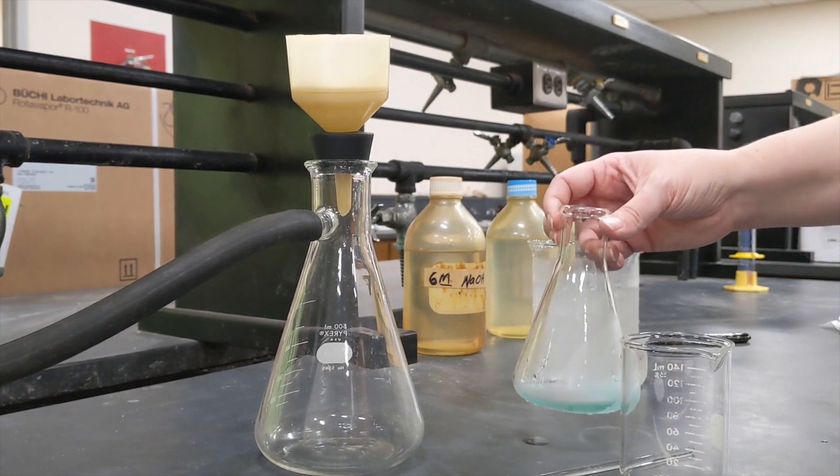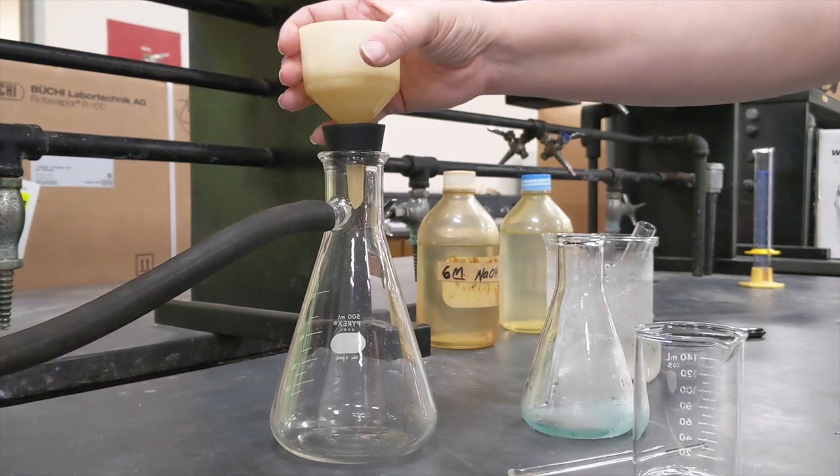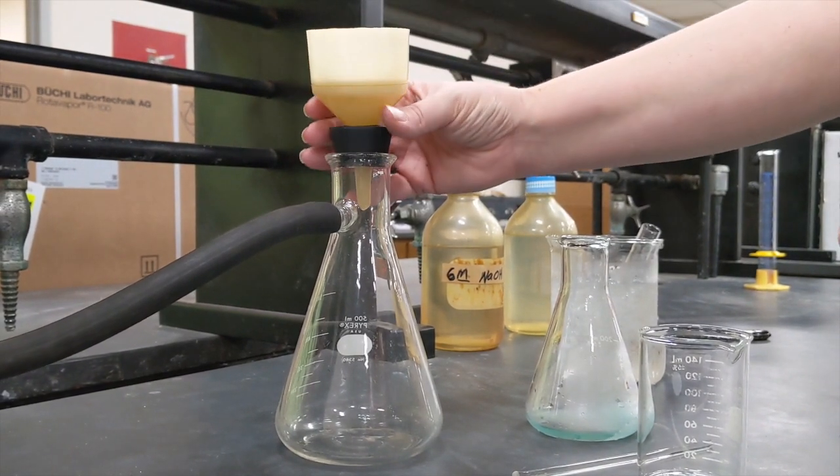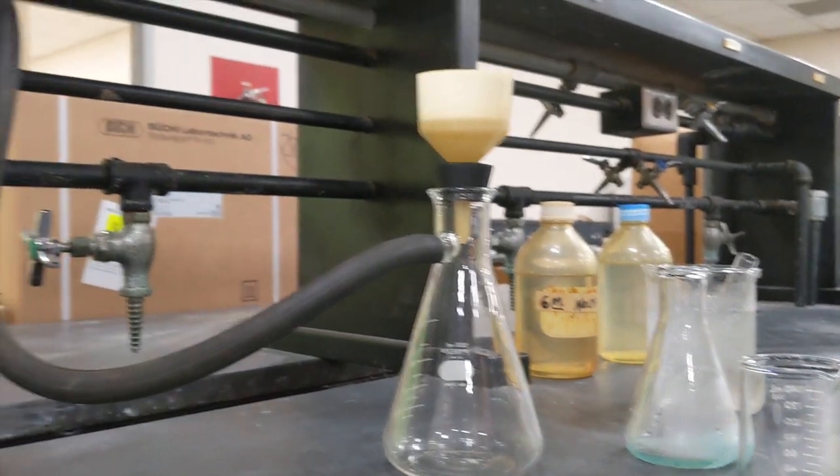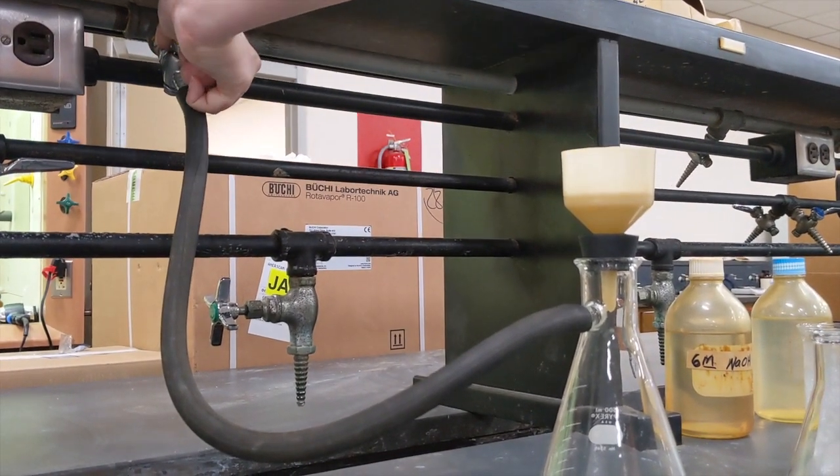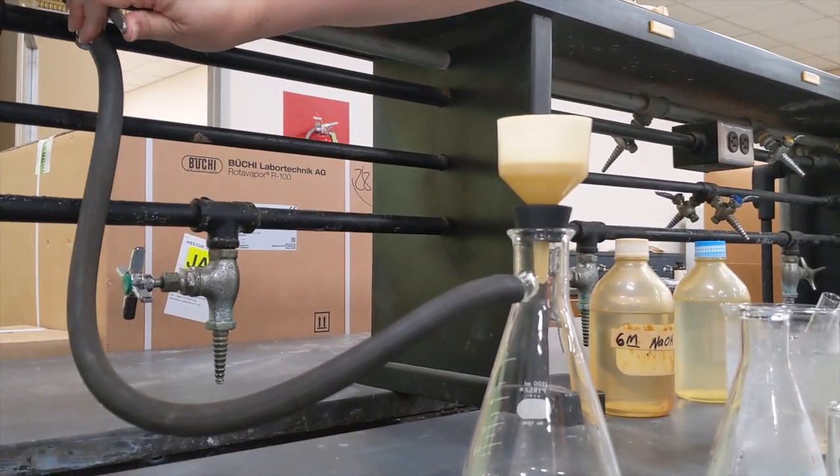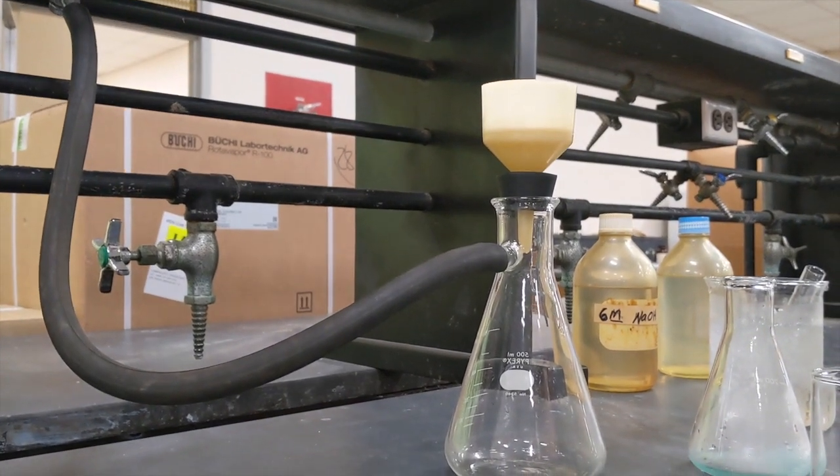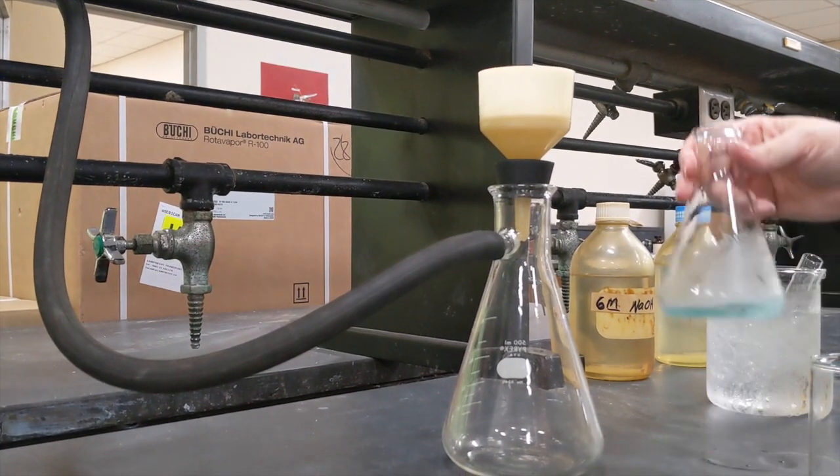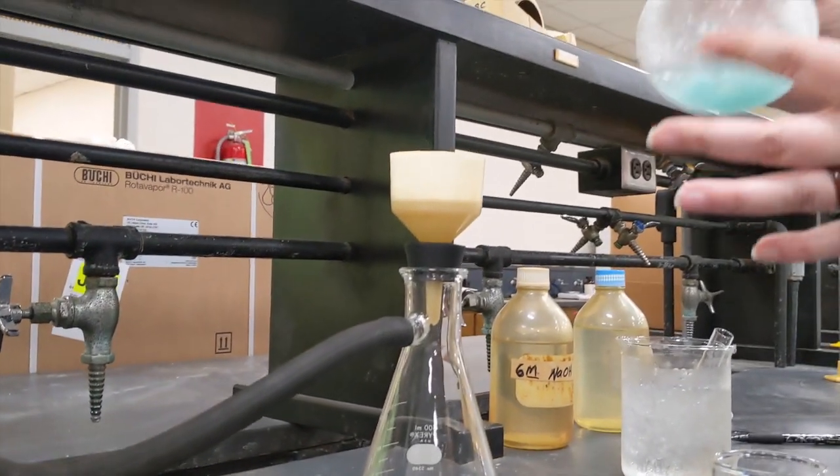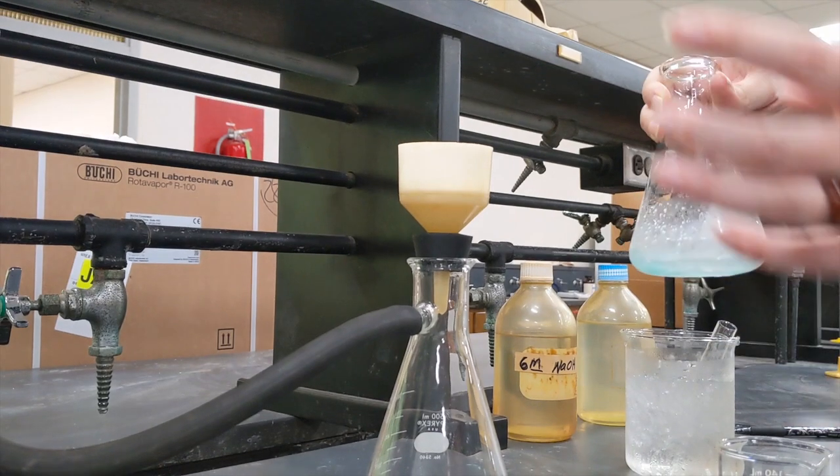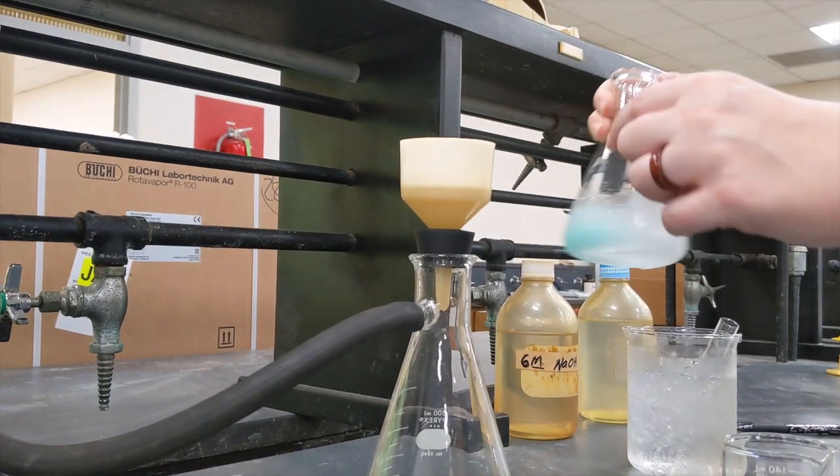I'm also going to use a different filter apparatus. This is a suction filtration apparatus. It is so much faster and easier than a gravity filtration apparatus, and we can do that because we have house vac here in the LSUS labs, which is pretty terrific. If you can hear that hissing sound, air is being pulled through this. So I'm going to swirl this around, try to get the solid sort of in the solution, and I'm going to pour it into here as quickly as I can.